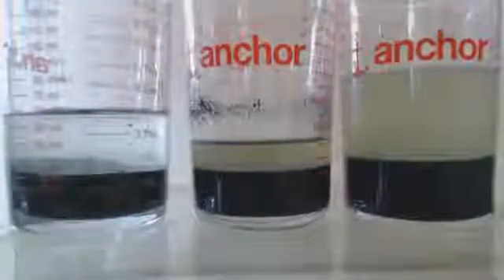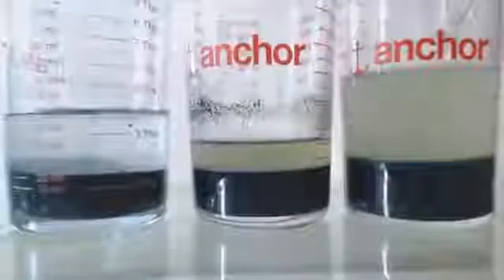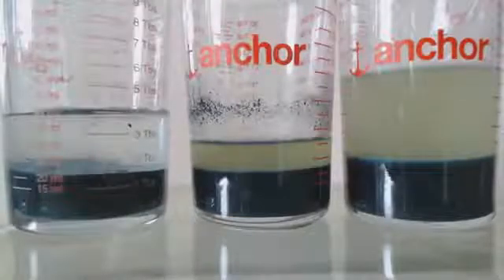Now the middle one has a 4 to 1 ratio, and you can see it has the same amount of precip.